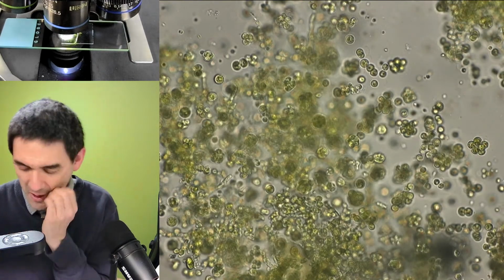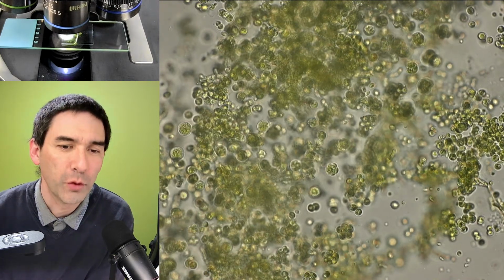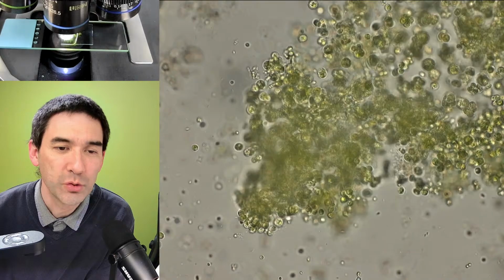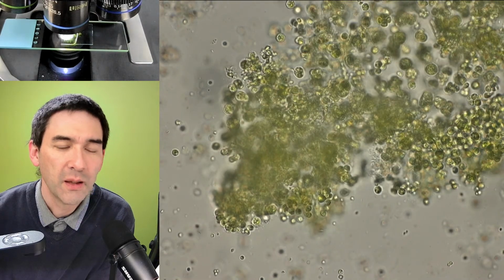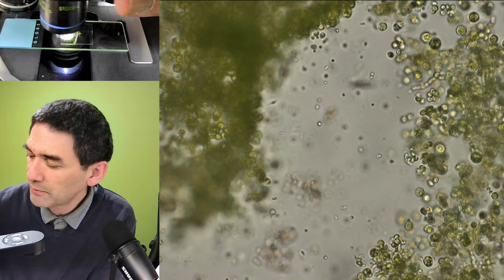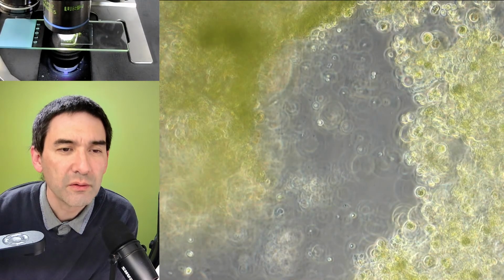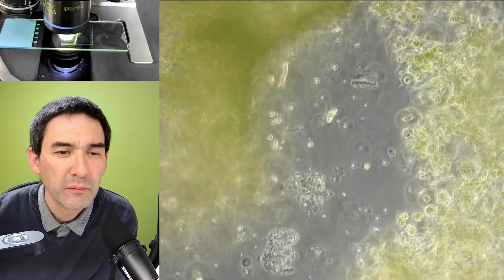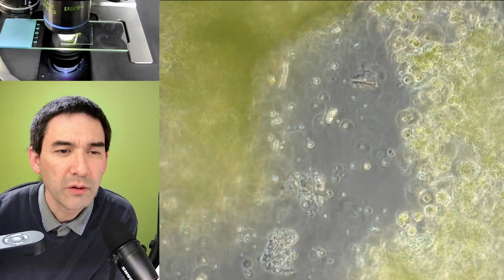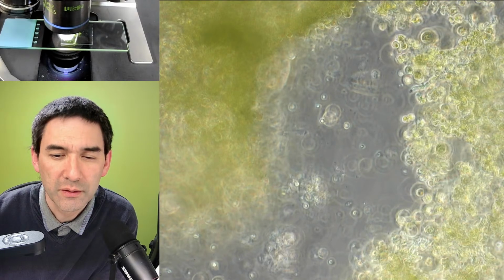Maybe if you just wait a little bit, you might actually see some oxygen bubbles forming, because of photosynthesis. That's usually something that I would do next. I could try the following. Let's try phase contrast. Maybe we're able to see some bacteria as well. So that's now phase contrast. Usually bacteria are seen as dark structures. There are not even that many bacteria here.